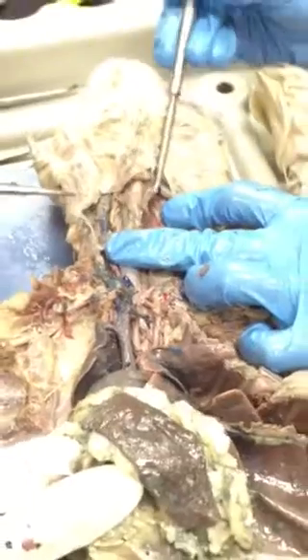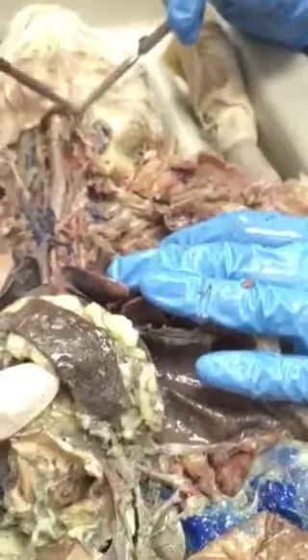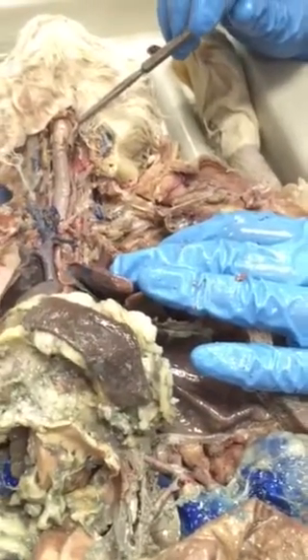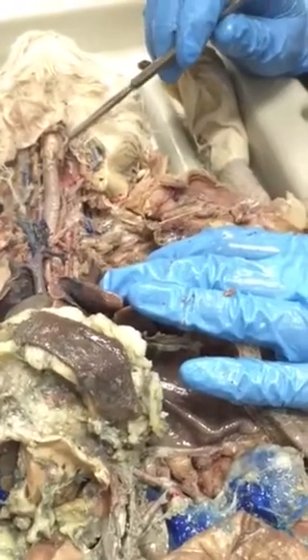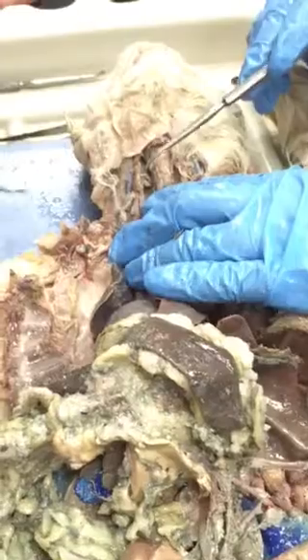That's all thyroid. What about the left and right external jugular? No, carotid, because jugular is a vein. Yeah, left and right external carotid. Isn't it way further up? Yeah, that's on our list for the cat. External carotid? Yeah. Internal is not on the cat list, the external is. And I was like, how do we find it?